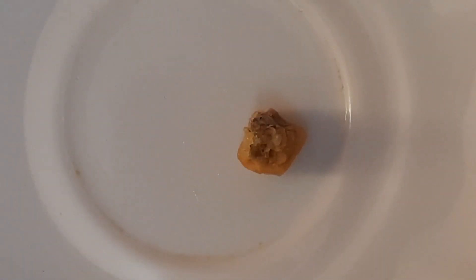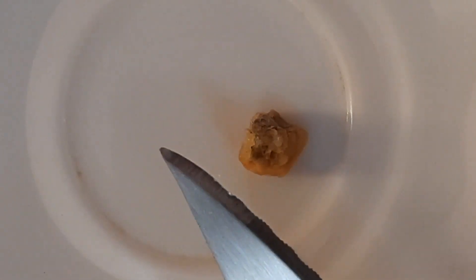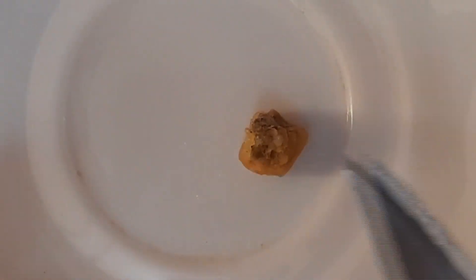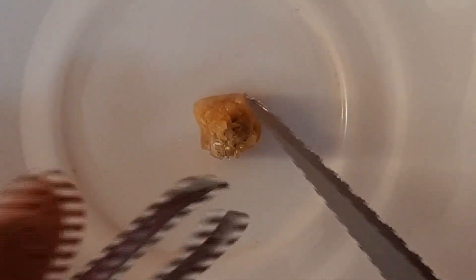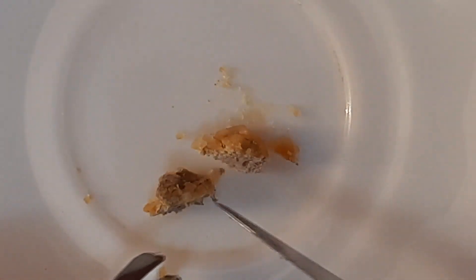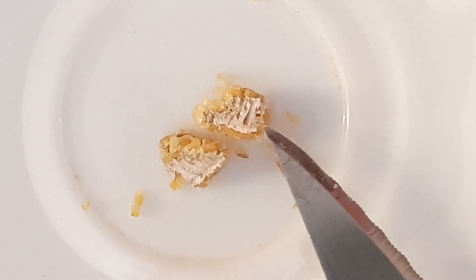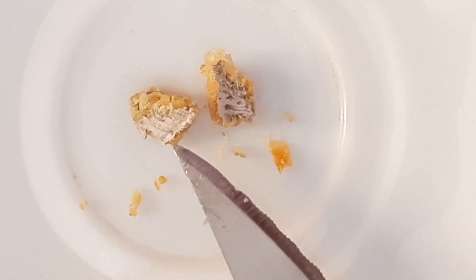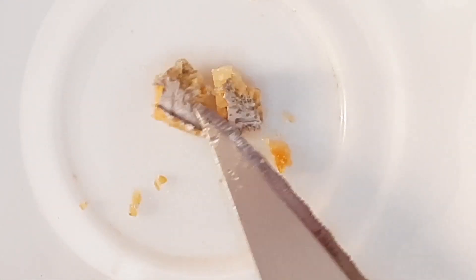You can see this sodium metal has become tarnished and brown. I am going to use the blunt side of this knife — the sharpened part is on one side and the blunt part on the other. I am going to cut it with the blunt side. Can you see the shiny part? It gets tarnished so fast. The shiny part has become dull white and soon it will become brown, reacting even with the oxygen in the air.